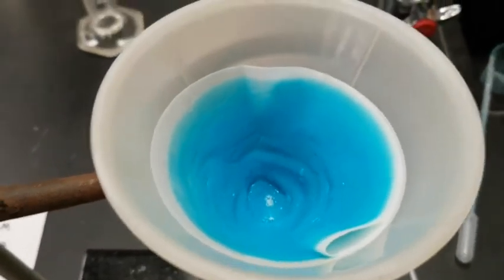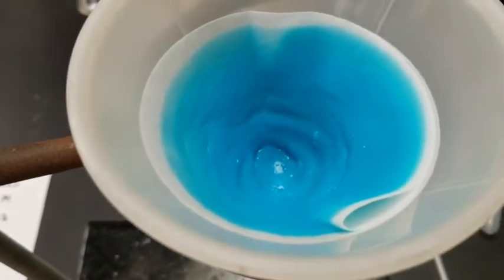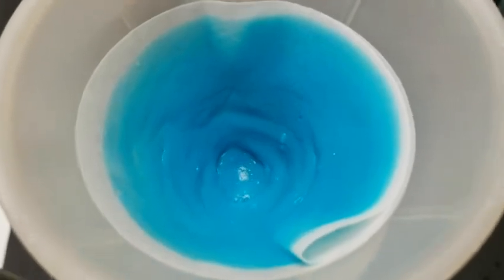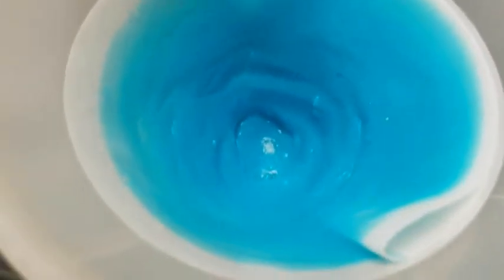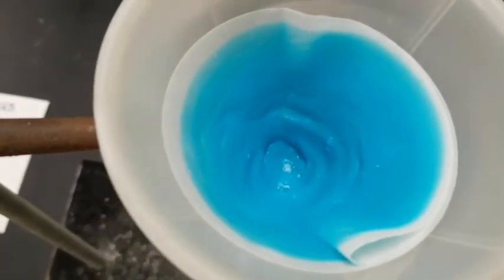What we now have is a filter that has really done a pretty good job of getting all of the precipitate there. But you can tell it's still kind of wet in there. We got to get rid of all of that water. And again, take a look at what came through down at the bottom. This is what was caught down below. Almost no blue down below. So up here is just the precipitate.